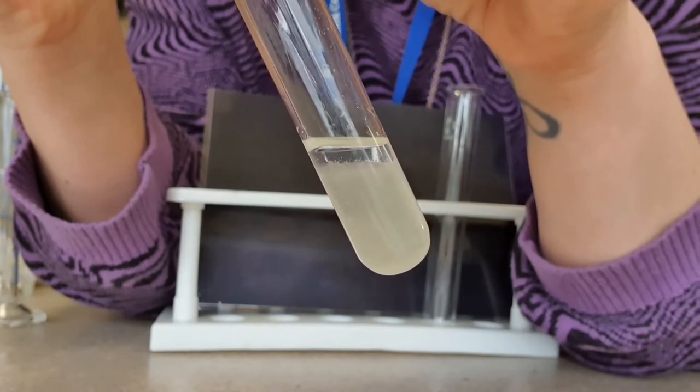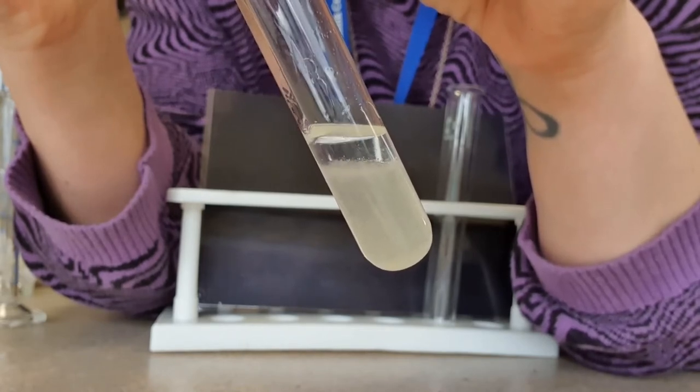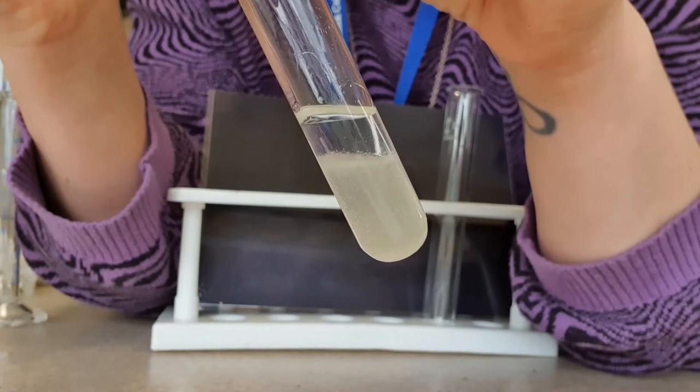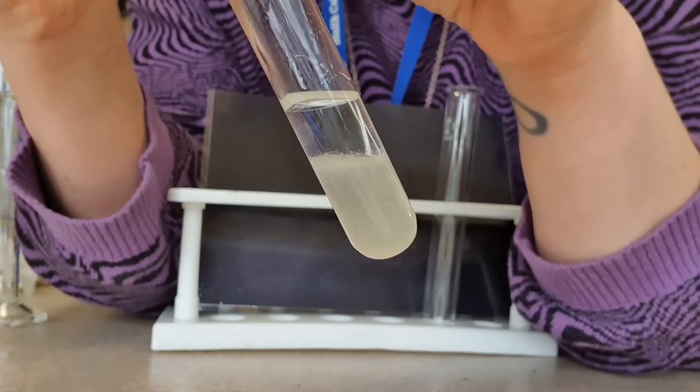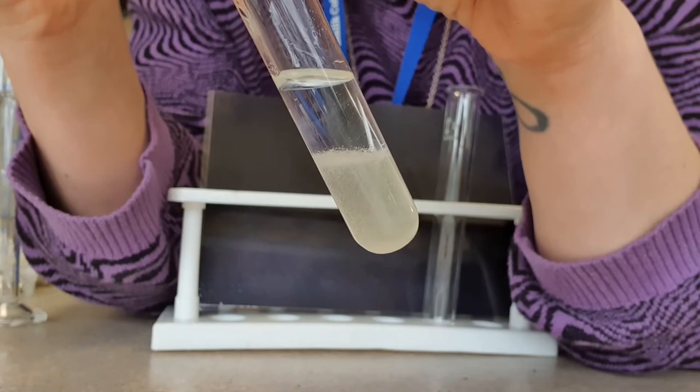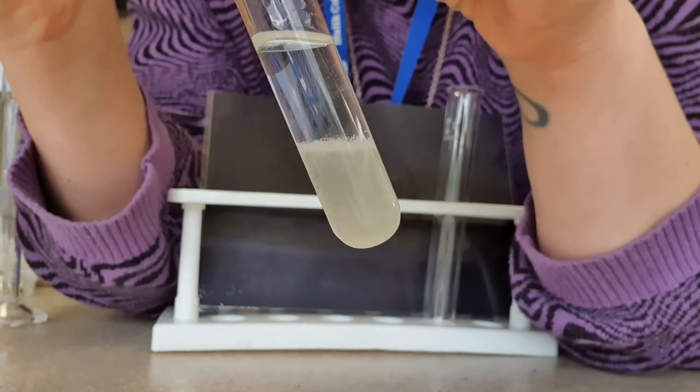There you go. See how that's just sitting on top? That's because ethanol is a lot less dense than water. So it floats on top.